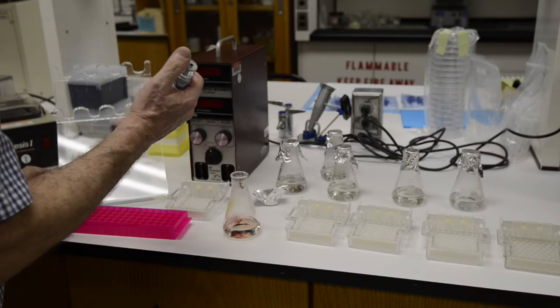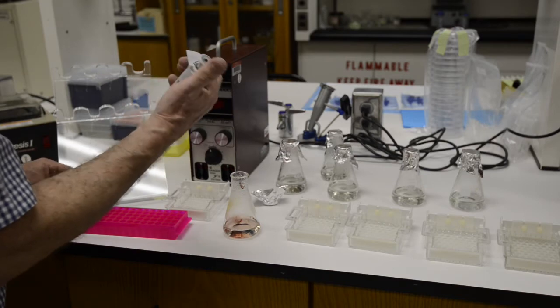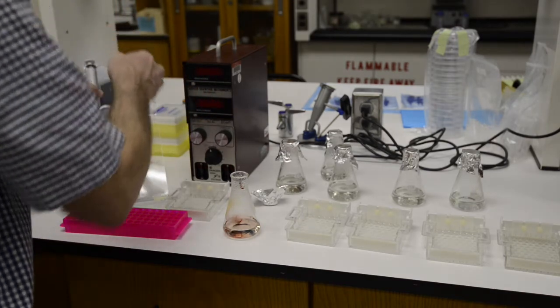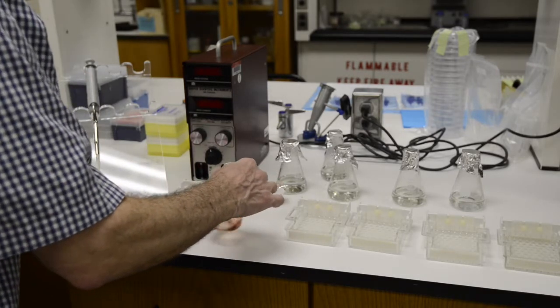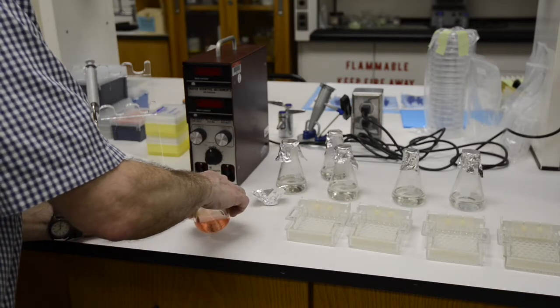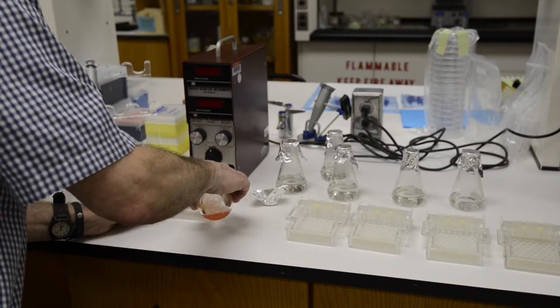Now spoiler alert, the amount of gel red that you just saw me put into that flask is the incorrect amount. I probably put in 10 times what should have gone in there. Your gel will not look red like this if you put the correct amount in. But there's no harm in this additional amount. It's just a waste of gel red.